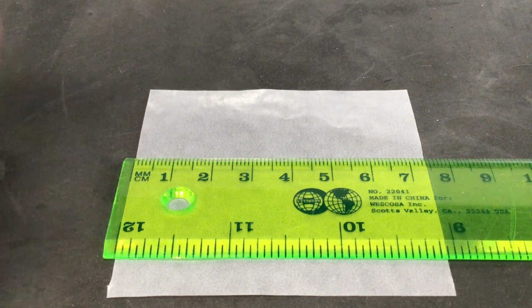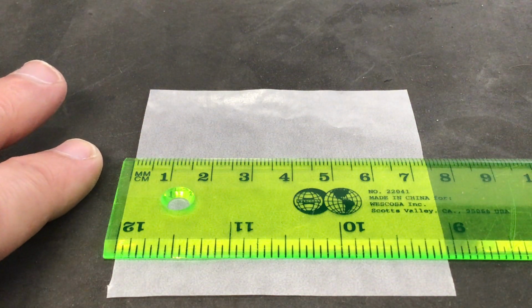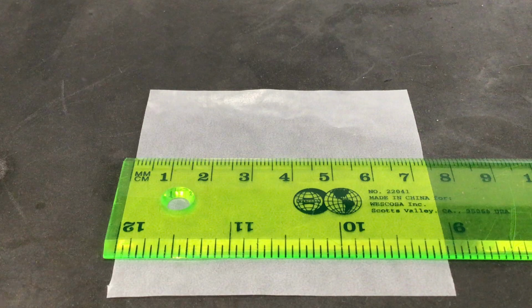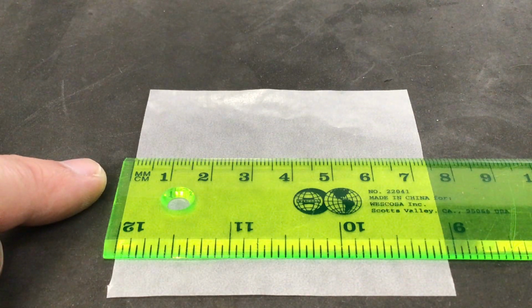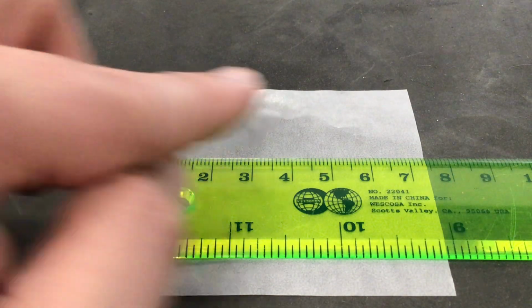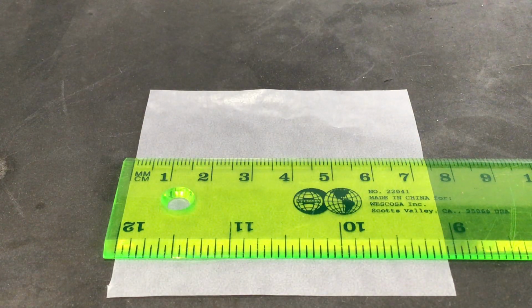Now, our goal as far as using this to make measurements, we're looking to line up the edge of whatever it is we're measuring the length of. Let's say I'm measuring the length of this piece of white paper. I'm just matching the very end line over here to the start of the white paper itself. And then we're seeing where we end up over here, and what tick mark we are closest to.